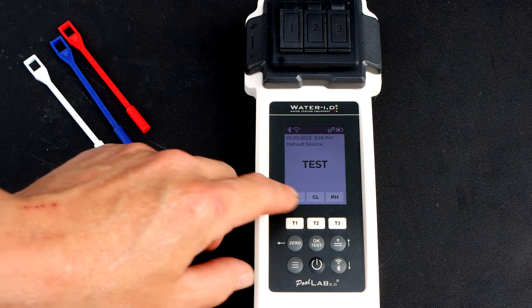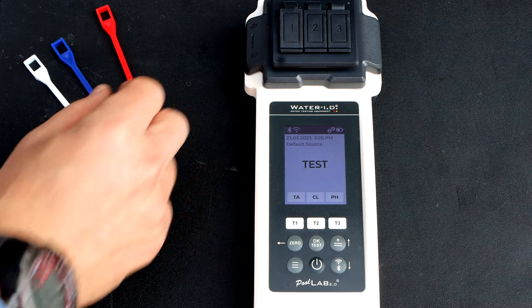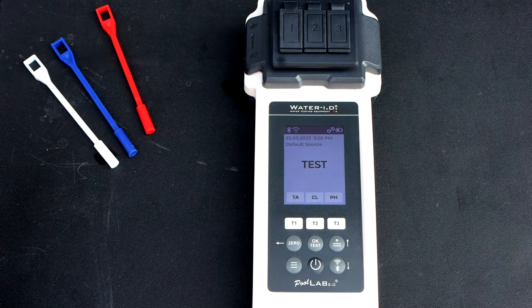Although these clips have been trimmed just for the sake of time in this video, I had a clock running during the testing, so you're going to see the real time displayed here on the top right.